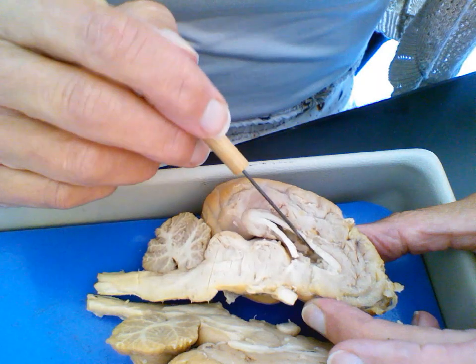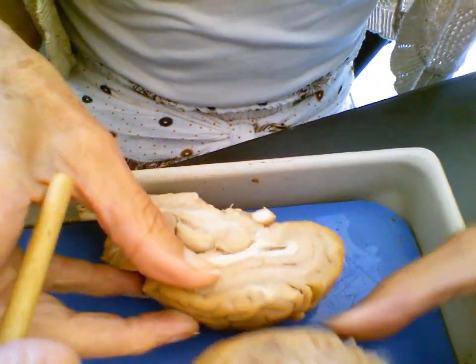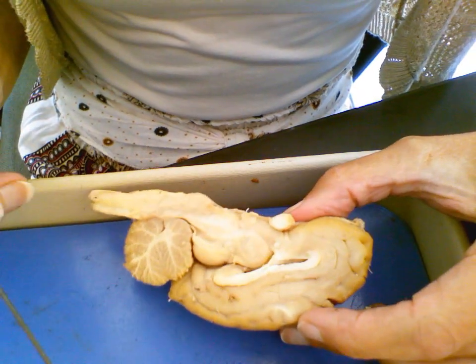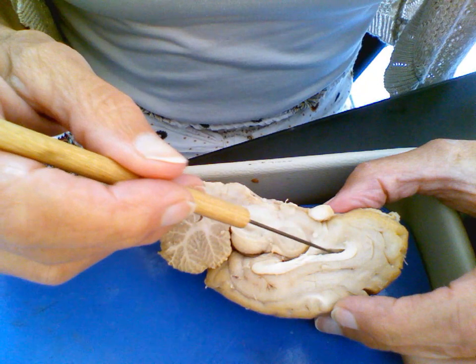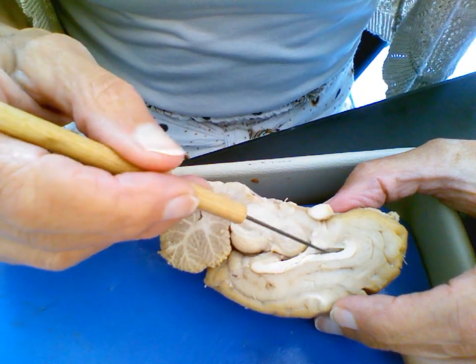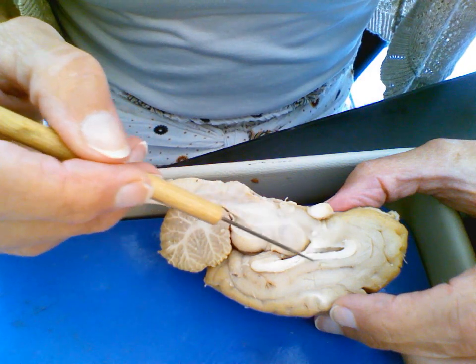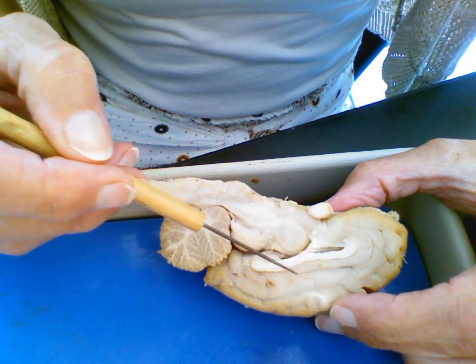The lateral ventricle, there's one on each side, so I'm going to switch to this part of the specimen. So you can see, I think, this one pretty well. Let's see if I can get that in a good position. So this too is the lateral ventricle. You can kind of see it as I put my probe right here, corpus callosum. And this right here is the cingulate gyrus.